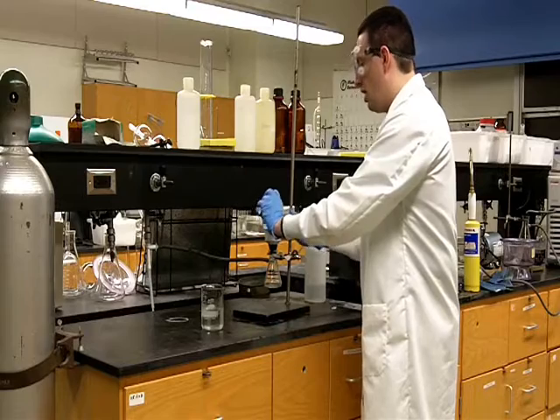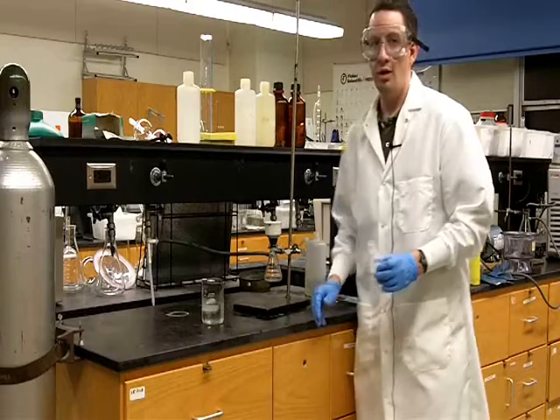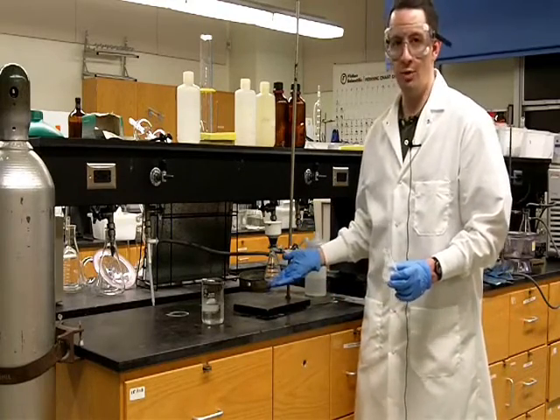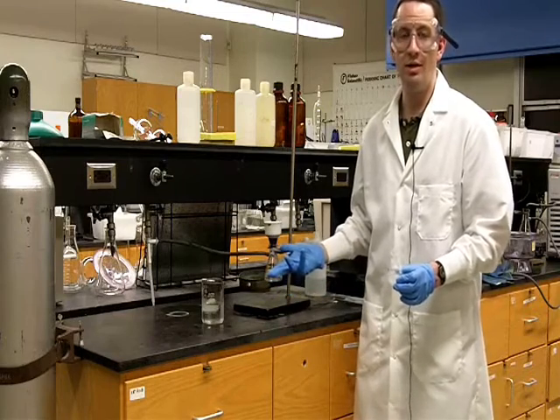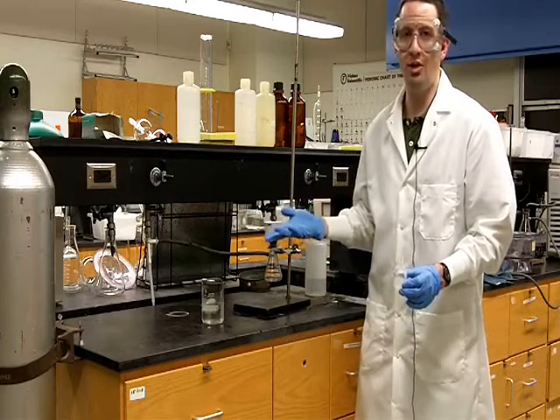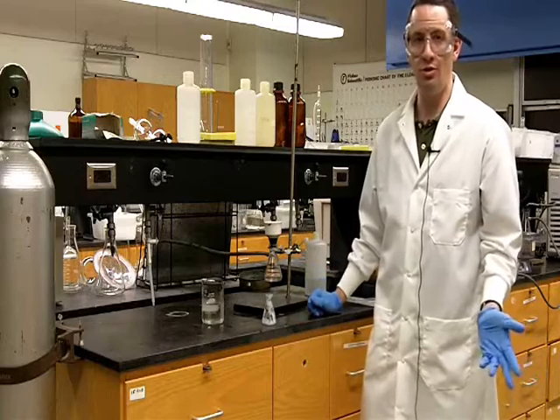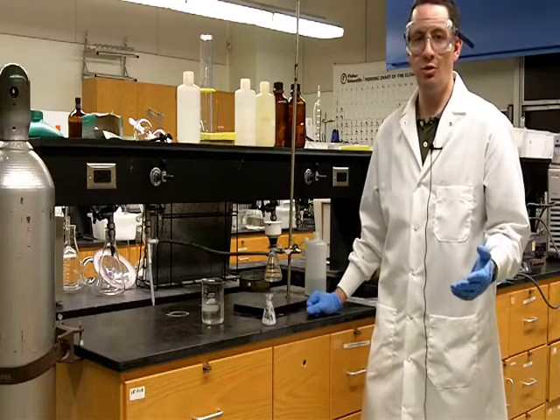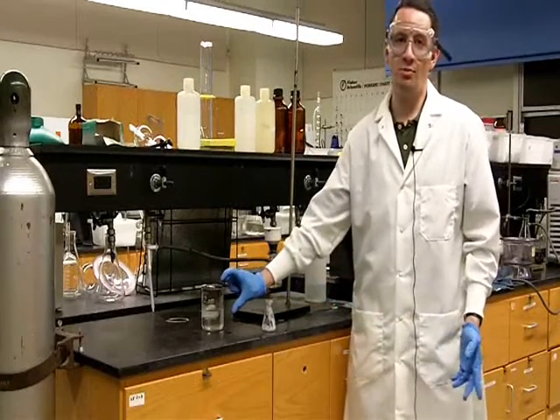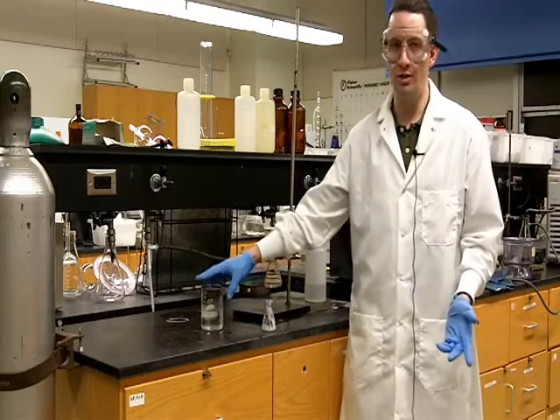But we can also try to use some solvent to transfer the remaining benzoic acid over. And the best solvent we can use is the solvent that we've been using for the recrystallization, water. But we don't want to use warm water, because the warmer the water is, the more it may dissolve the benzoic acid. So we want water that's been cooled down to 0 degrees. Now, if we're using an organic solvent for a recrystallization, we should also have a small test tube or beaker of that solvent in our ice bath so it's cooled and ready to go.